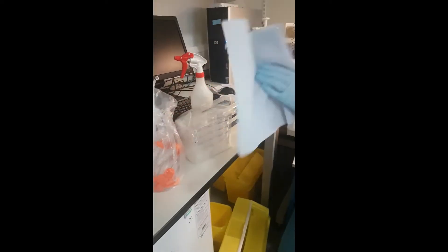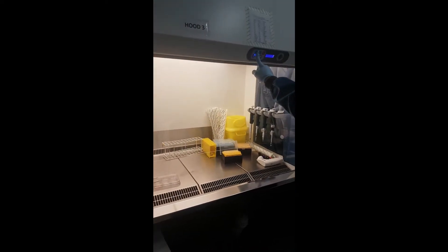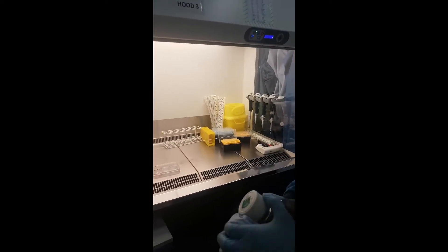Clean the medium — the hood is already cleaned and the vacuum has been replaced. For the settings, you first press up, because the window has to be open first. Then you can press the green button, and when cleaning we start from the back to the front.